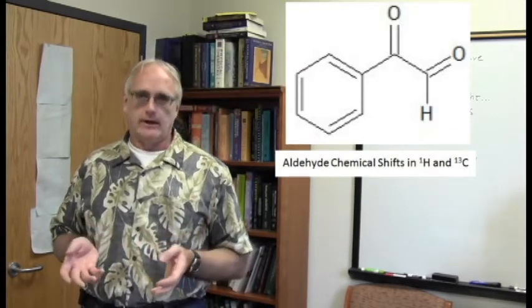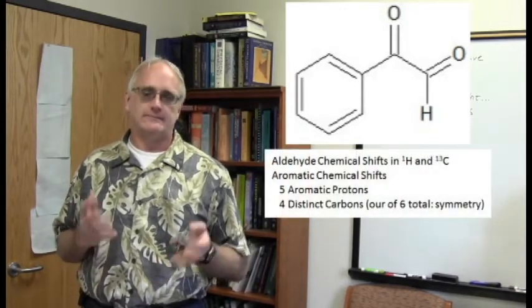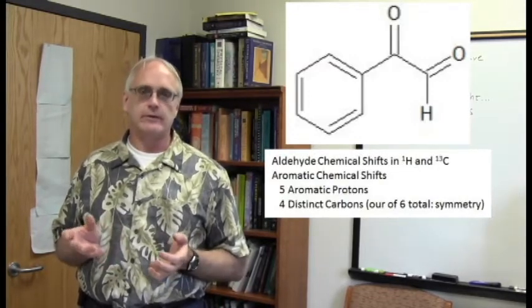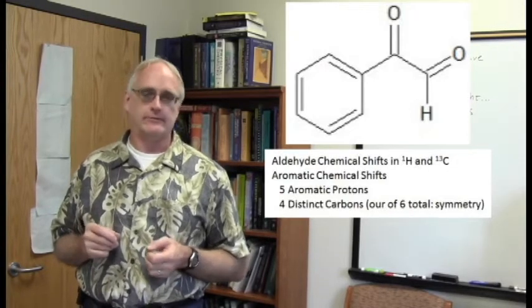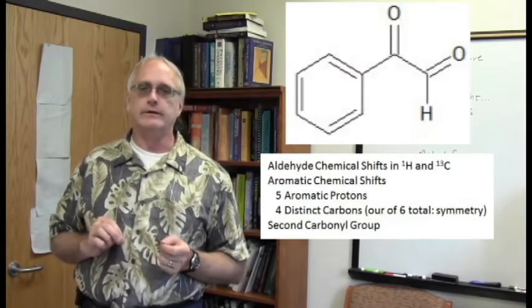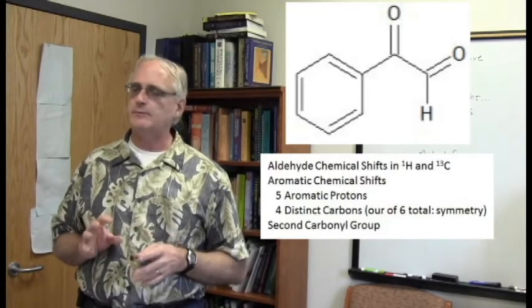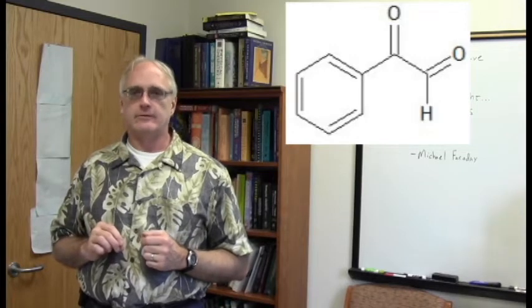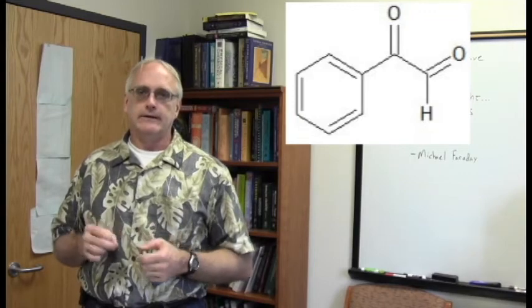You see an aromatic ring here. It has 6 carbons total, 5 total hydrogens, but of course symmetry is going to play a role in this monosubstituted ring. We should see 5 aromatic hydrogens. We should see 4 distinct carbons. And then there's this other carbonyl group in here, which might be a little bit unusual. You don't often see carbonyls right next to other carbonyls like that, so that may be a little atypical, but otherwise it seemed to be a pretty straightforward structure and pretty straightforward what we should look for in our spectra.